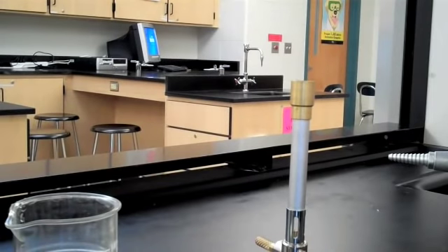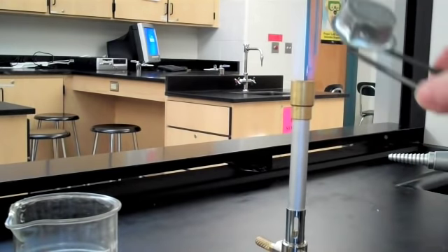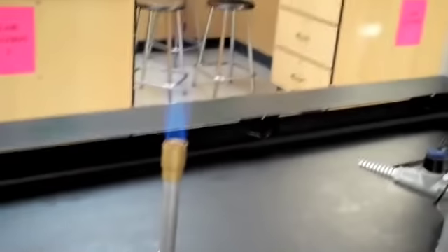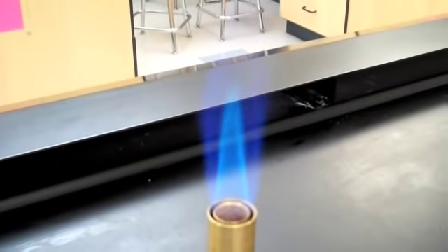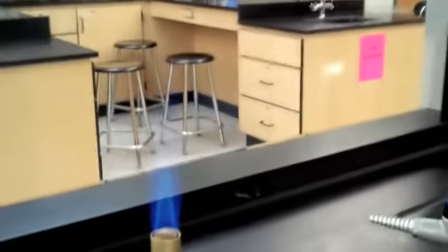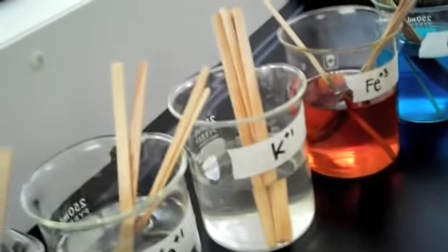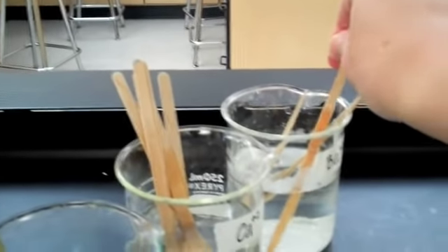Next, we are going to light the Bunsen burner by turning on the gas valve and using our striker. You should observe your two blue cones, the inner blue cone and the outer blue cone. We are now going to begin testing. Choose one of our samples to begin with. I'm going to go in the order of the data table. First, we're going to test barium.